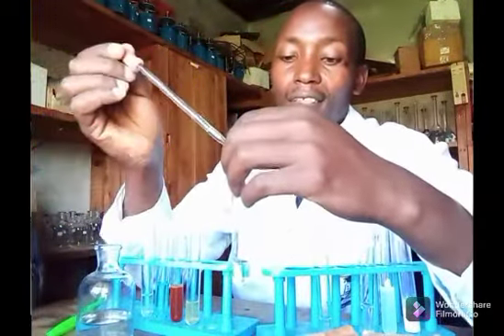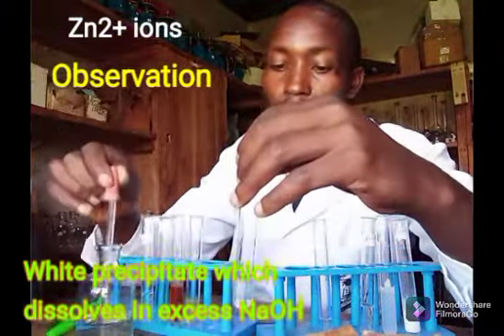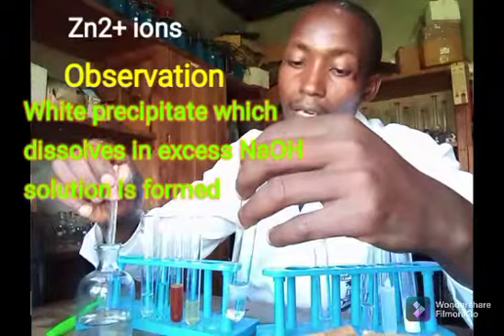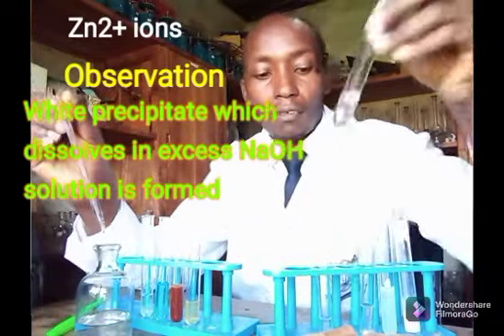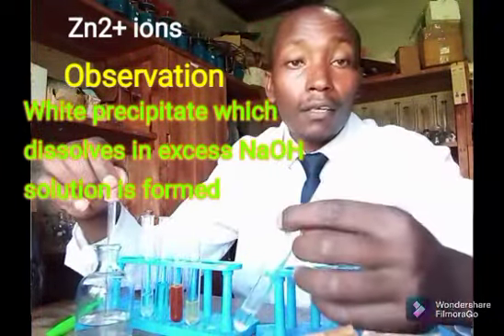Then the next is zinc. Zinc, again, you can see some white precipitate forming with a few drops of sodium hydroxide. Yes, the white precipitate is there. So I can add excess. With excess, the white precipitate has dissolved. That is again with zinc.